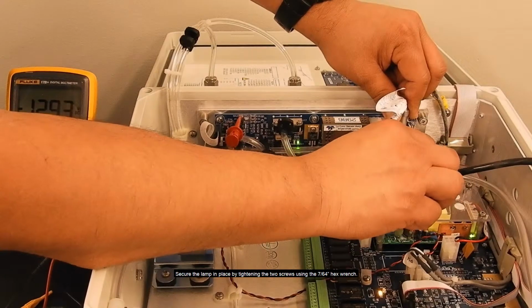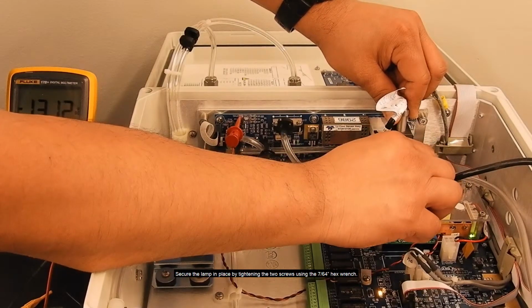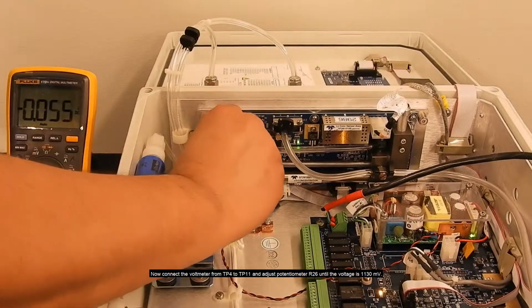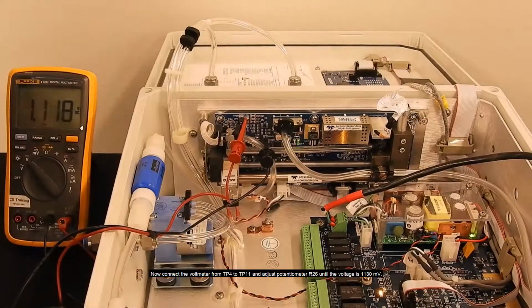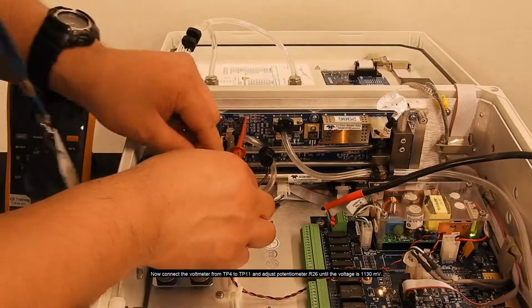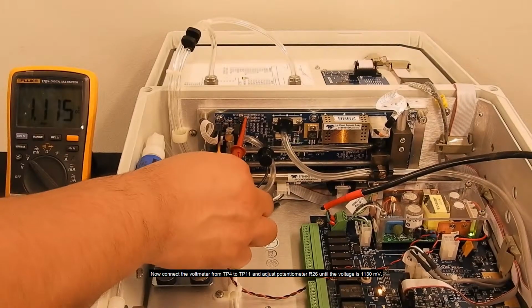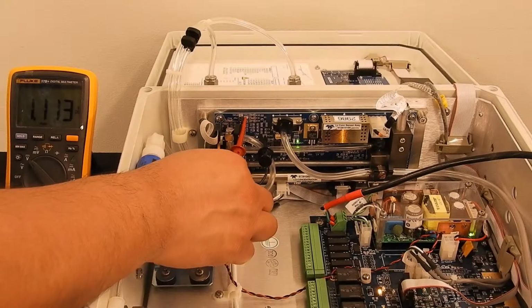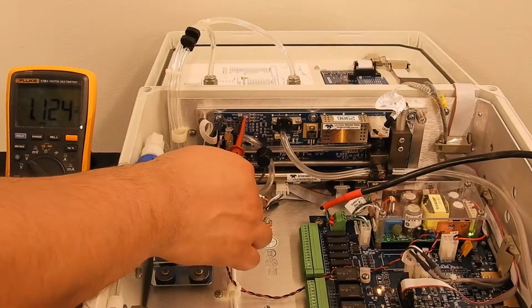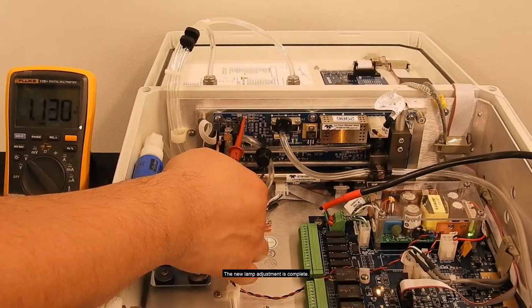Secure the lamp in place by tightening the two screws using the hex wrench. Now connect the voltmeter between TP4 and TP11 and adjust potentiometer R26 until the voltage is 1130. A new lamp adjustment is complete.